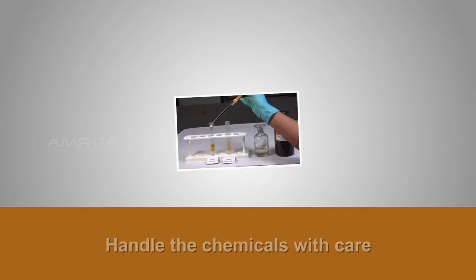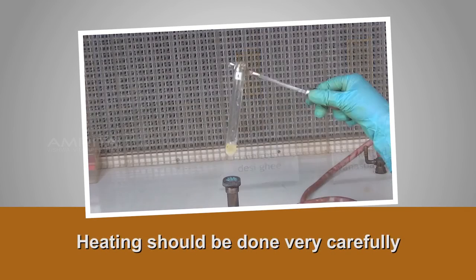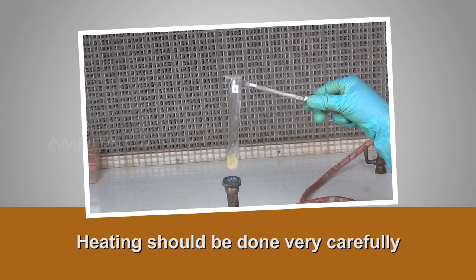Precautions: Handle the chemicals with care. Heating should be done very carefully.